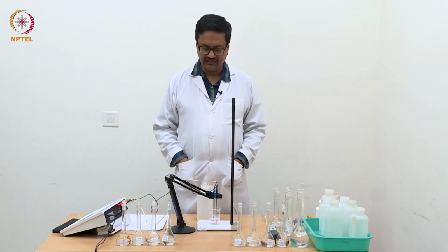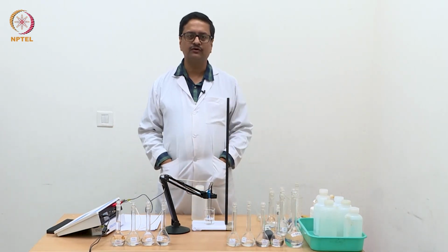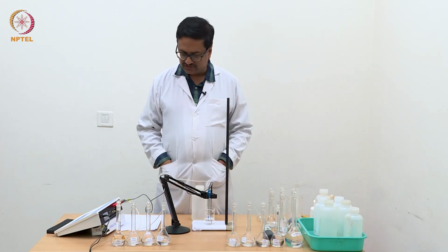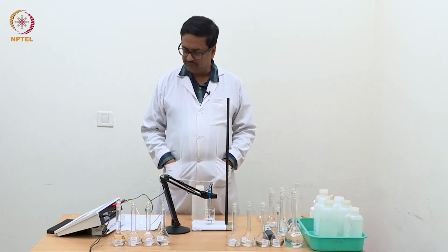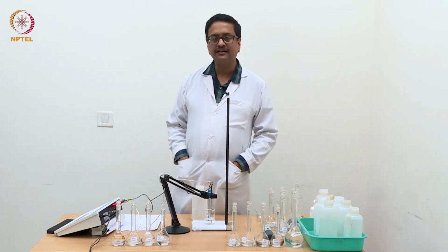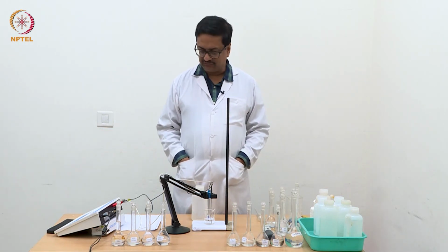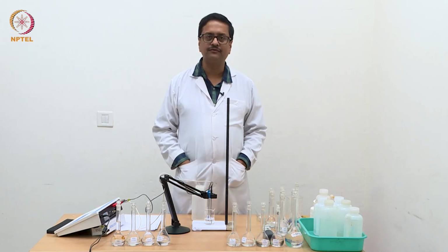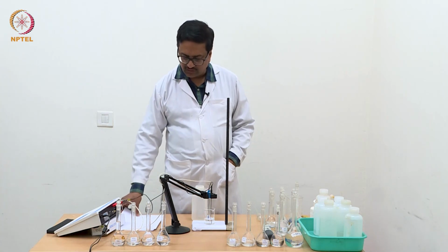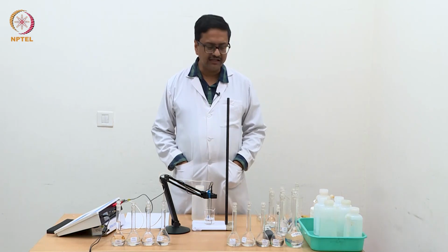Welcome back to this demonstration of experiments for the elementary electrochemistry course. In the previous video, we demonstrated the measurement of conductance of a series of HCl solutions, starting with concentration N/256 normal up to N/4. And as we discussed in the previous video, now I have prepared dilute solutions of acetic acid.